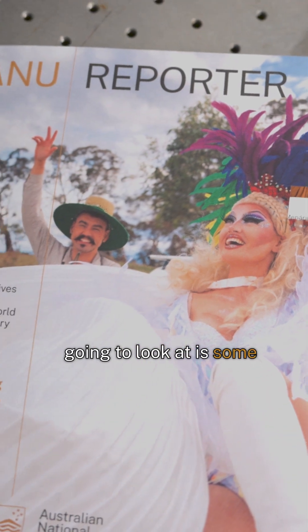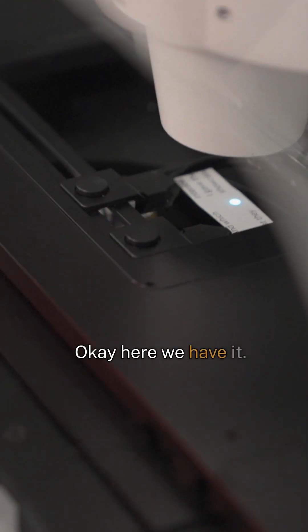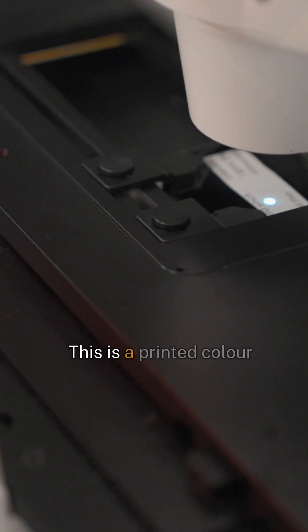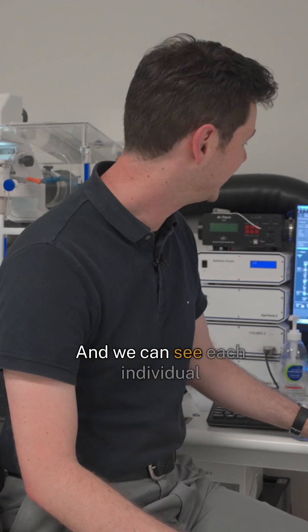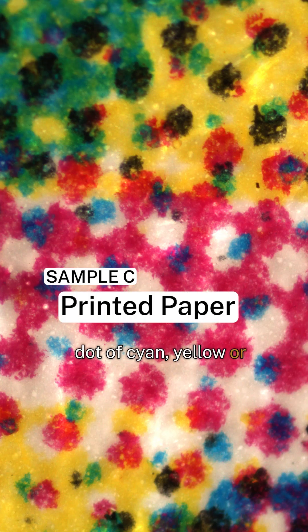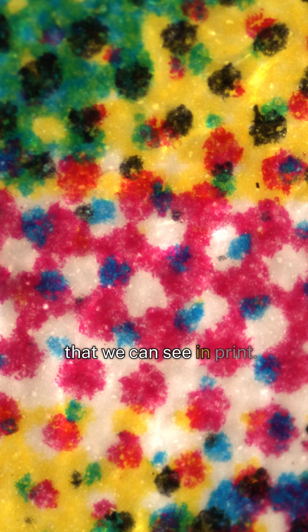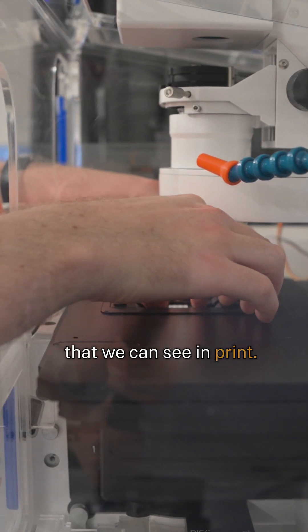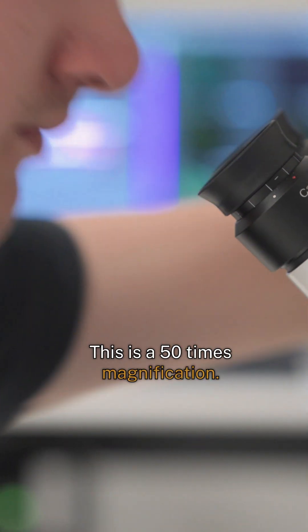The next thing we're going to look at is some printed paper. Here we have it — printed color on a page, and we can see each individual dot of cyan, yellow, or magenta that the printer lays down to make all of the visible colors that we can see in print. This is at 50 times magnification.